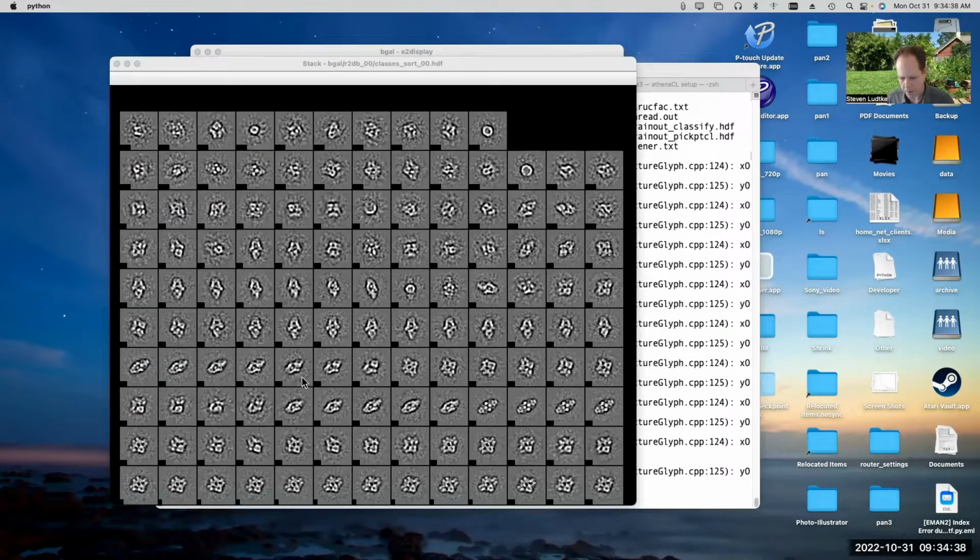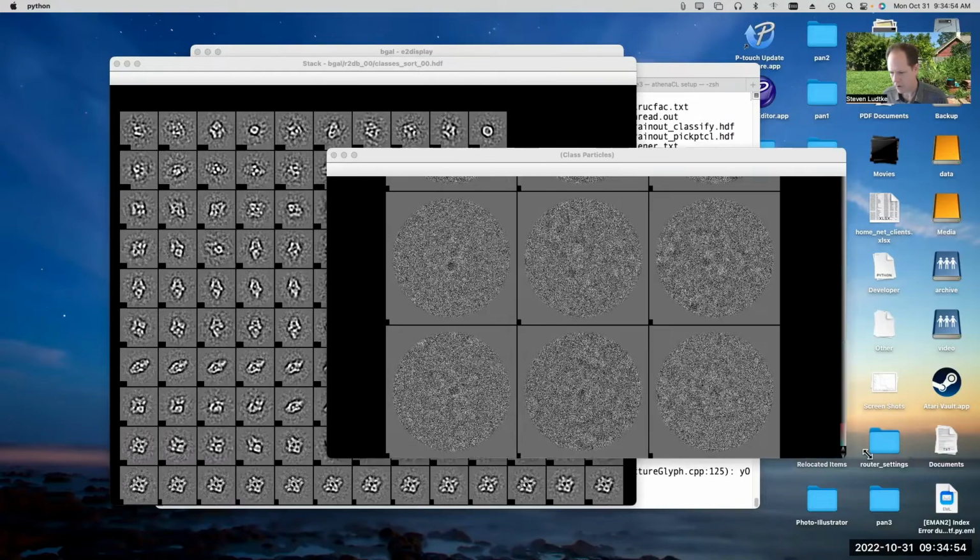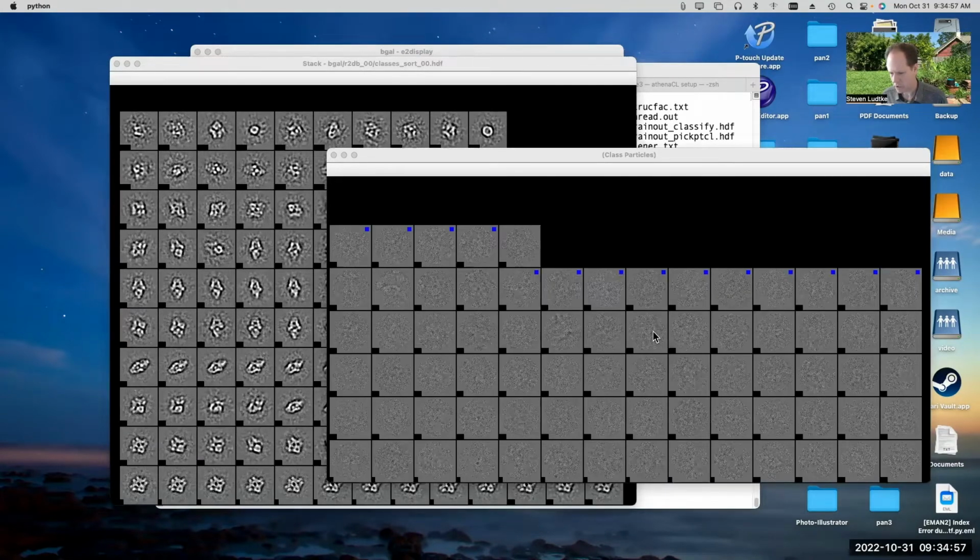Now, these particles are not filtered in any way. So if we look at the raw particles that are associated with these class averages, it can be a little difficult to see anything. For example, if I double click on this, that'll show me all of the particles that went into that particular class average. And you can see that it's a little difficult to really see the particles there. I mean, you can tell that they're in the boxes, but it's not terrific. So it can actually be better, when you're trying to do this sort of getting rid of bad particles thing, to use filtered particles for that process.